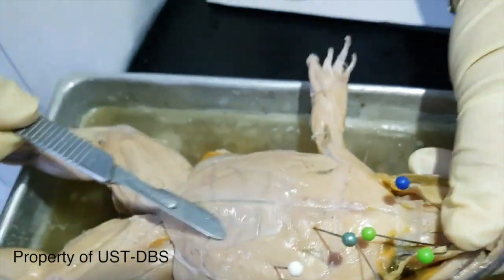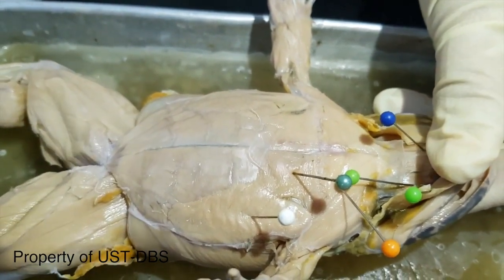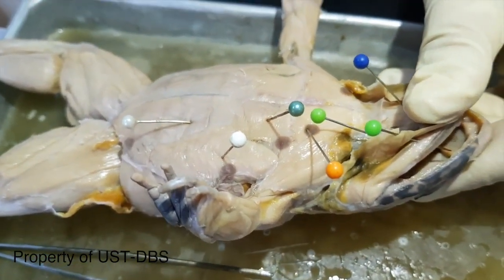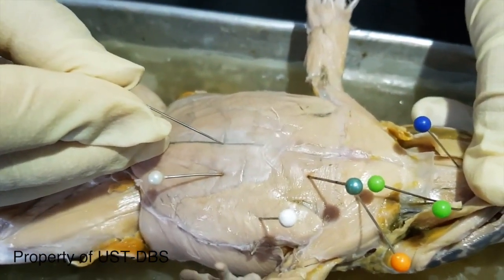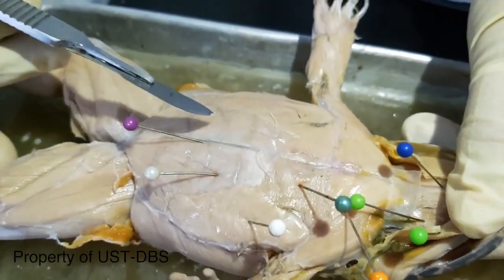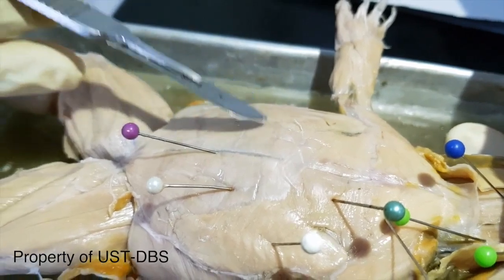This muscle here on the abdomen is the rectus abdominis. It is separated in the middle by the linea alba. So this is the rectus abdominis and the linea alba, the middle part. That one is darkly colored because of the ventral abdominal vein that is present. Not in the book, but there is another set of tendinous bands that separate the segments from each other. That's the inscriptiones tendineae.